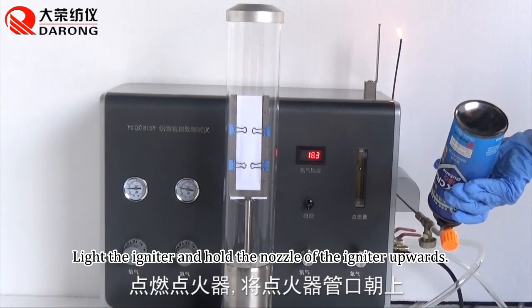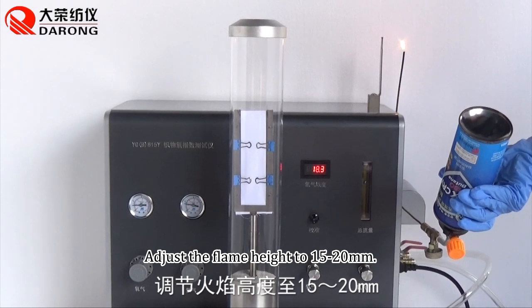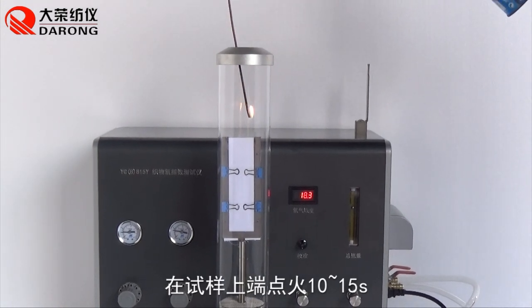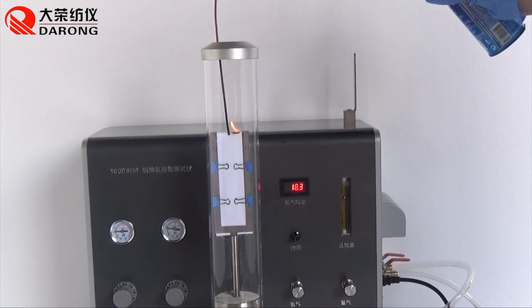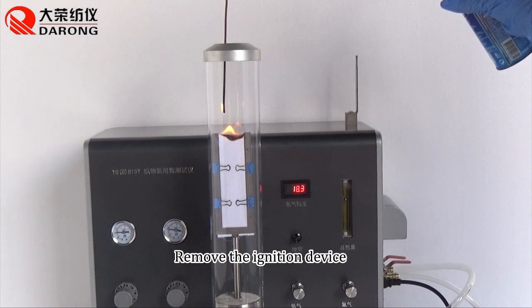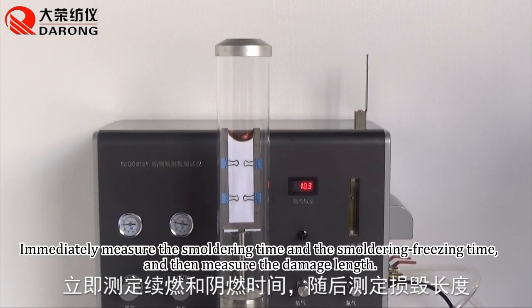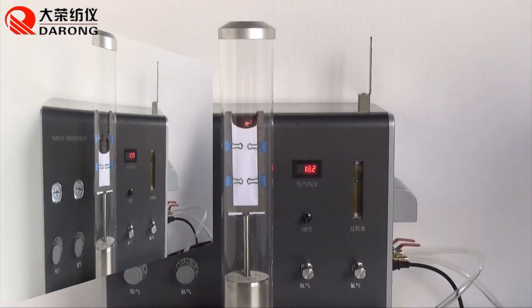Light the igniter and hold the nozzle of the igniter upwards. Adjust the flame height to 15 to 20 millimeters. Light the sample at its upper end for 10 to 15 seconds. Remove the ignition device. Immediately measure the smoldering time and the afterflame time, and then measure the damage length.